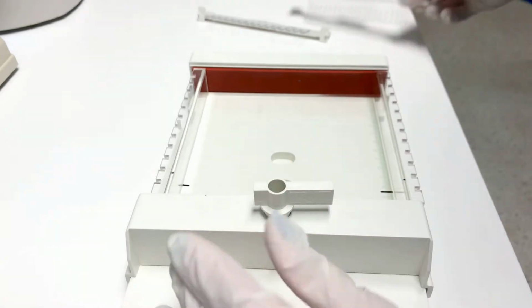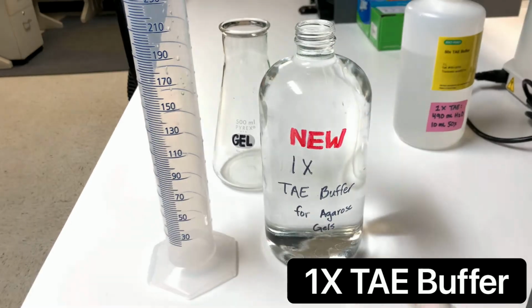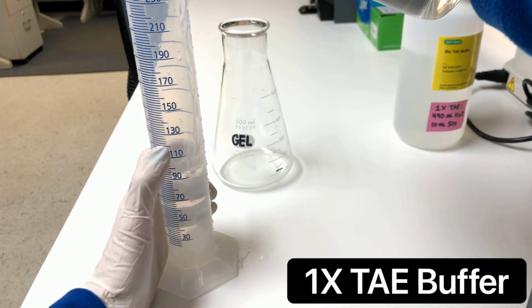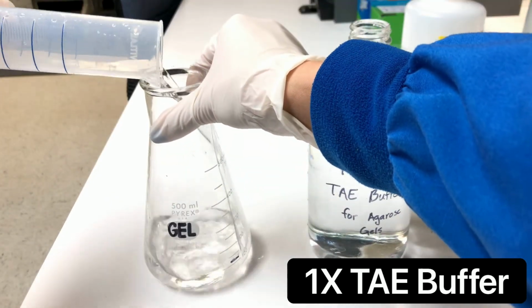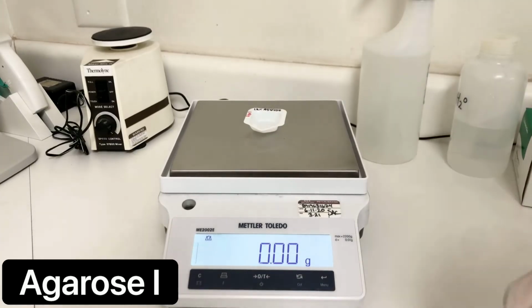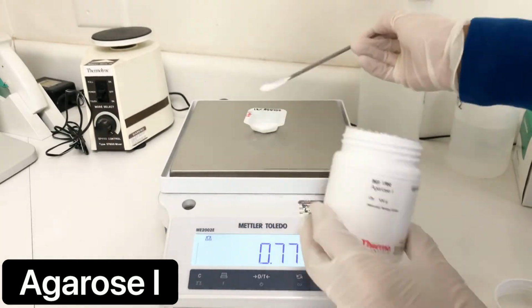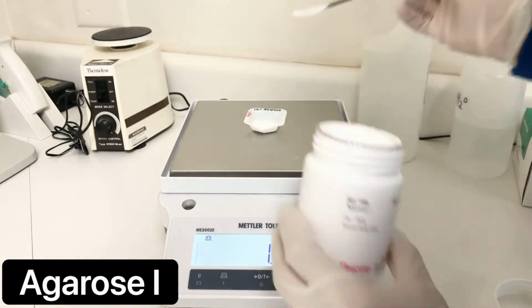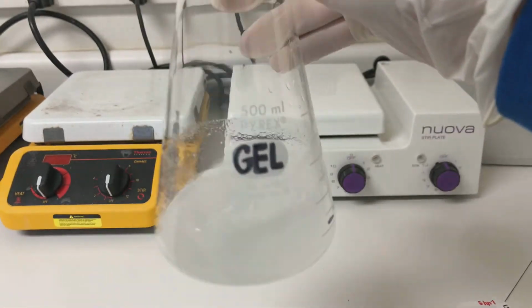First, set up your gel box. To make our gel, I'm going to add X amount of 1x TAE buffer to a glass flask. Then I'm going to measure out X amount of agarose. The weight should be 1.2% of the total volume. Add the agarose to your flask.